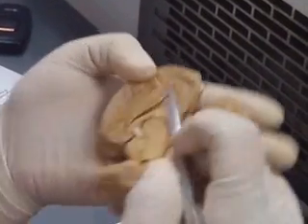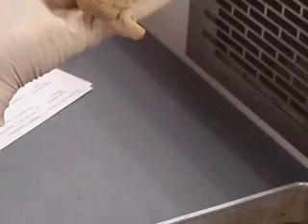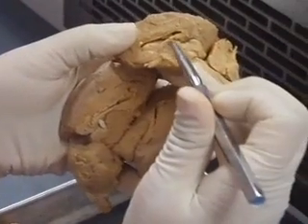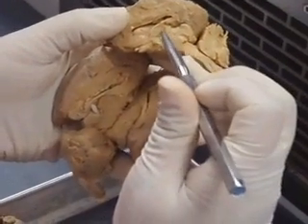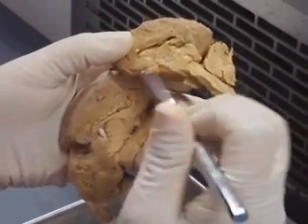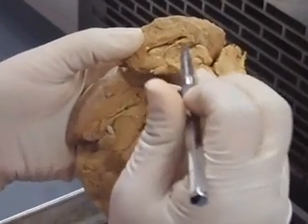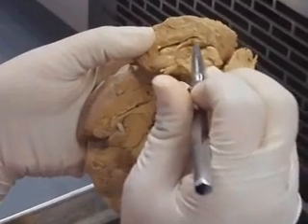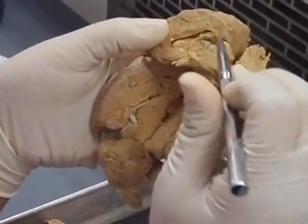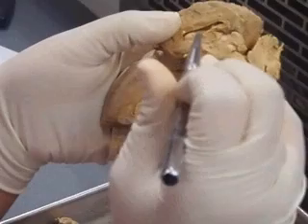The massa intermedia — I'm trying to find a better one here. Thalamus is on the outside, massa intermedia in the middle. The massa intermedia connects to both sides and this is the thalamus on top. This is the third ventricle. Lateral ventricle, third ventricle, thalamus, massa intermedia.